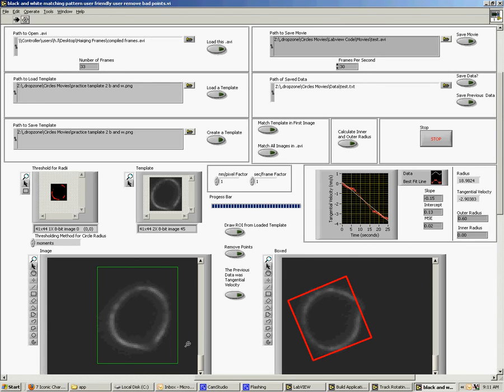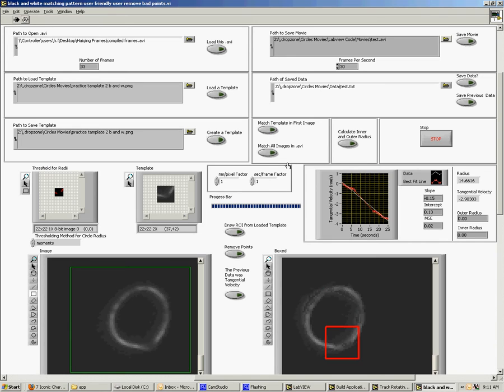Now there's also another option here if you want. I've added the ability for this to actually track a point revolving around the microtubule instead of the whole microtubule itself. So to do this, let's create a template of a small point on it, draw the ROI again, match it, and let's see how this works. There we go. Now you can't use this data because this assumed that you were tracking a whole microtubule and not a point. So to fix that, you'll have to click this button. The previous data was tangential velocity.